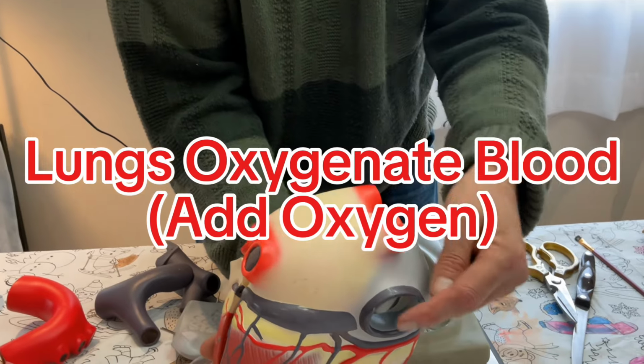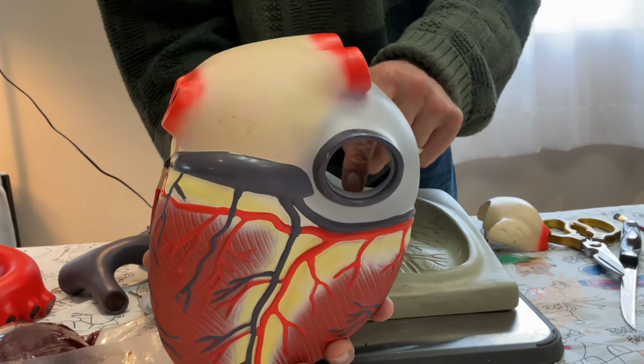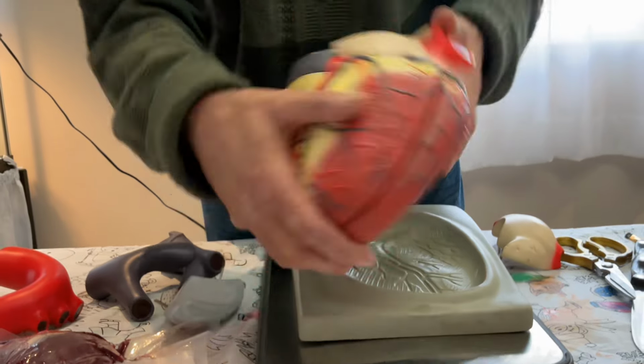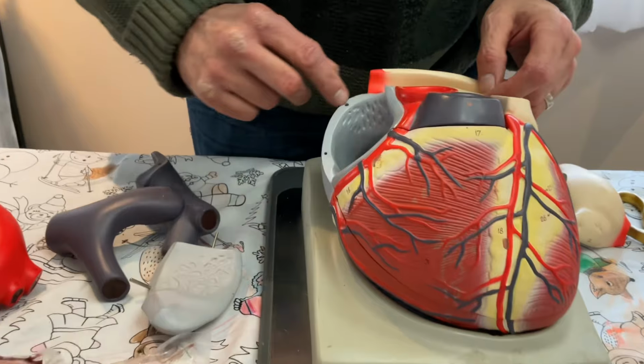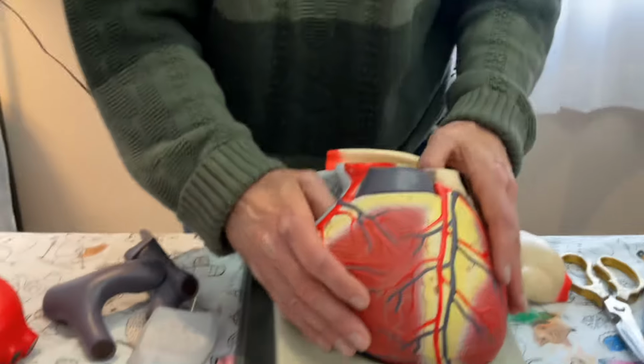When the blood goes to the body, it gets deoxygenated. All the oxygen gets lost, and it goes here. So let's talk about the journey of deoxygenated blood. Now we're going to look inside. You can see these walls here, not very thick, not very muscly. And when we look at the actual heart, you'll see that a little bit more.